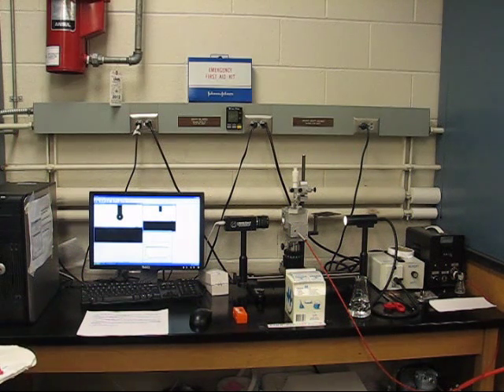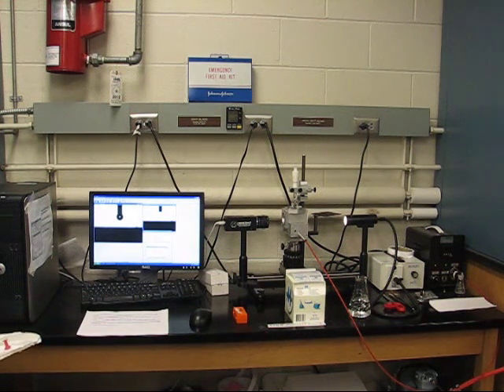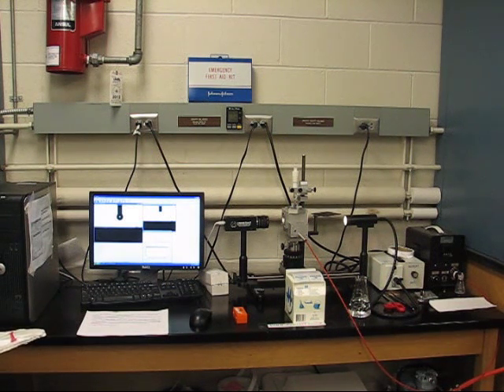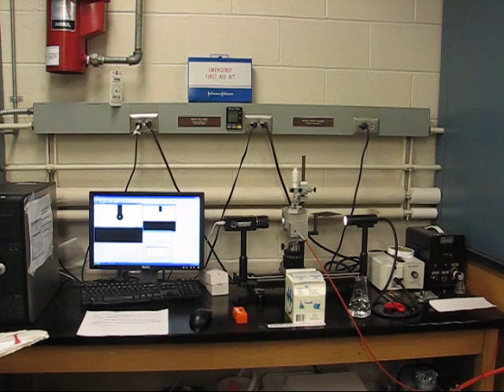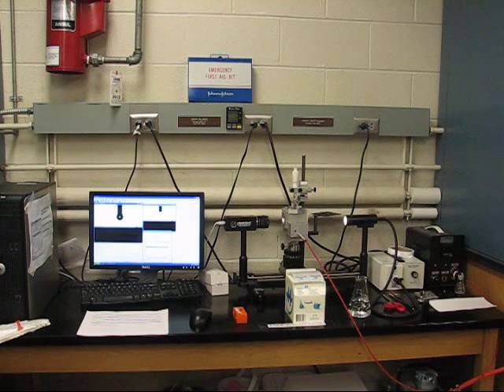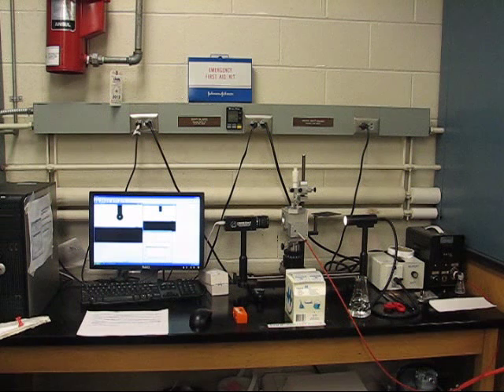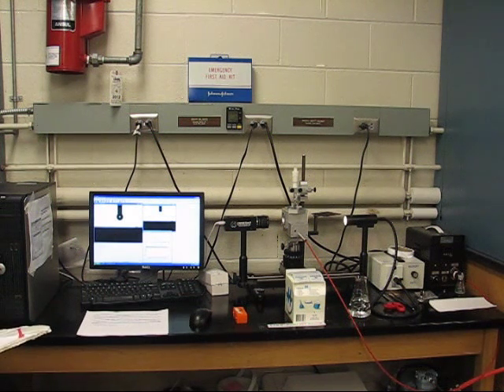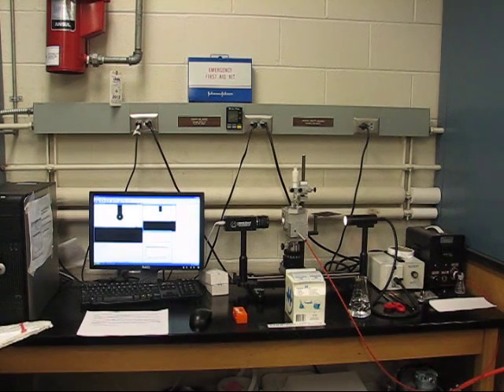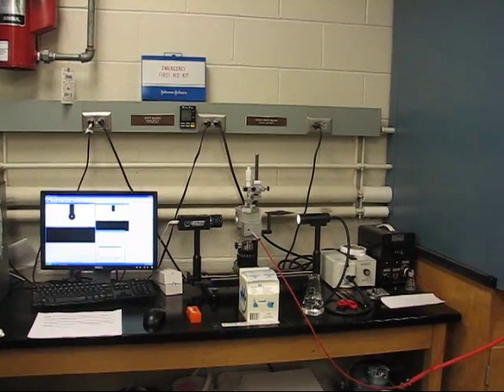A drop of liquid is placed on the solid surface and an enlarged image of the drop is obtained by photographing. The dimensions of the drop image are measured and used to determine the contact angle. Sandstone and carbonate formations are represented by small polished quartz and carbonate blocks respectively. A small drop of water is laid on the smooth surface of cover glass and parafilm, then the enlarged image of the water drop is obtained by photographing, and the dimensions of the drop image are used to calculate the contact angle in the system.